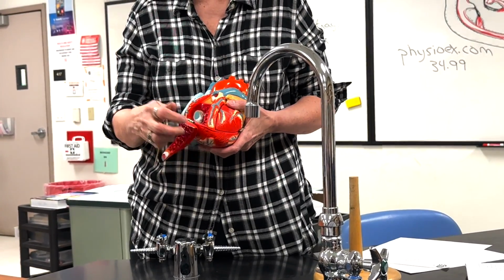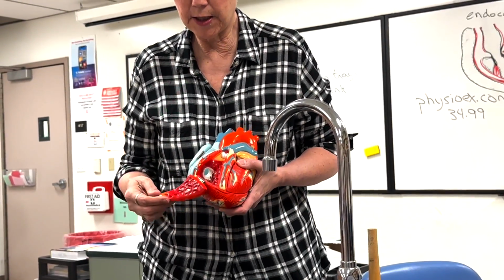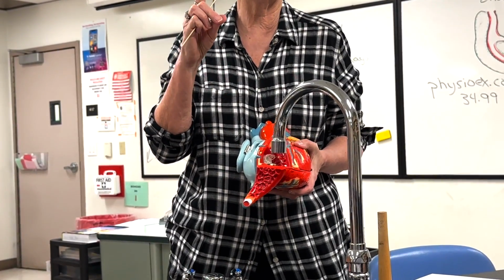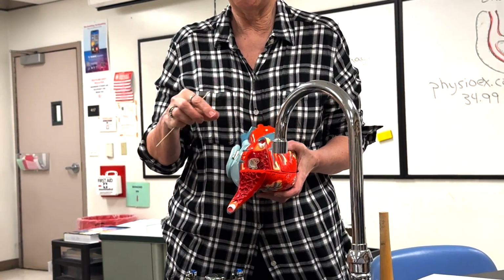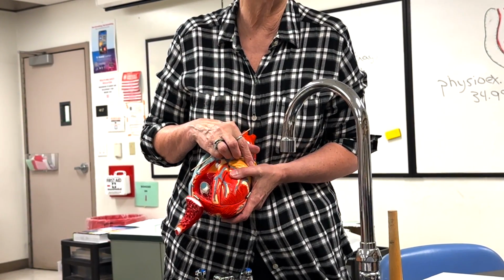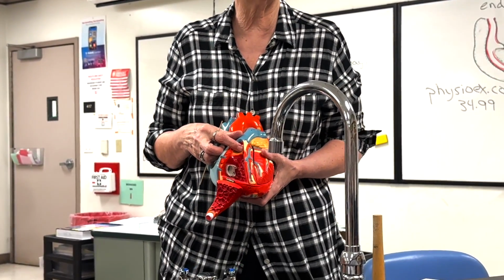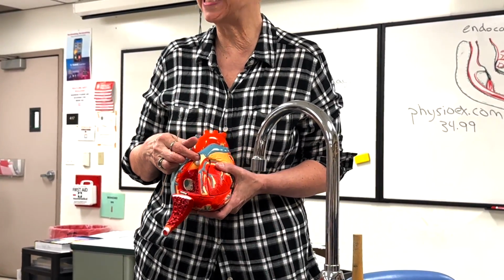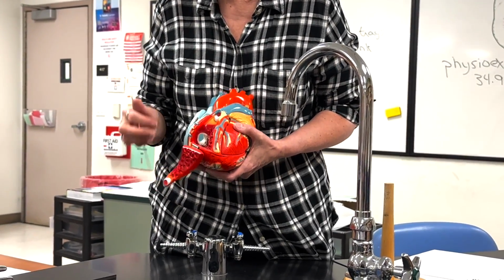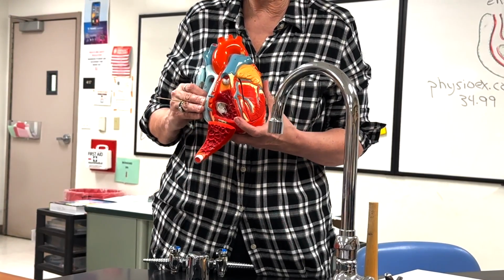Then when the ventricles contract, blood goes out both the pulmonary trunk and the aorta, but we're following 1 drop of blood. So the other valve is right here. Each semilunar valve has 3 leaflets, while the left atrioventricular valve has 2 and the right atrioventricular has 3. So these are under low pressure, much lower pressure. They don't have chordae tendineae, and they will fill as blood flows back towards the heart at relaxation. So there's 1 valve leaflet and the 2 others, and blood then goes out the pulmonary trunk to the pulmonary arteries.